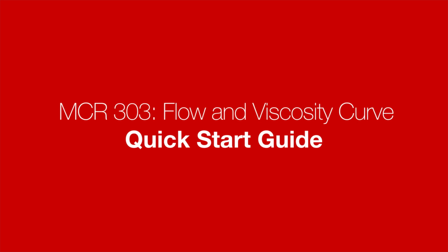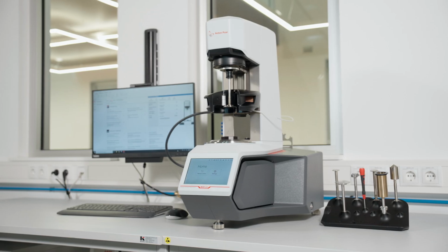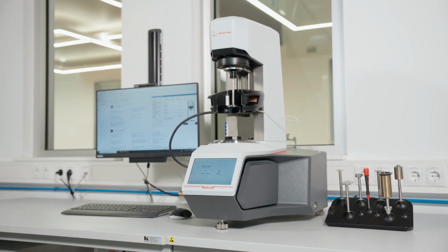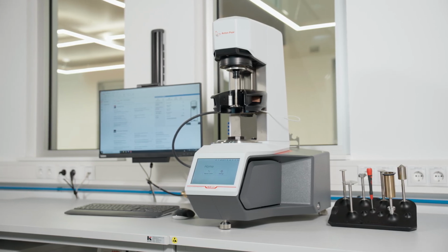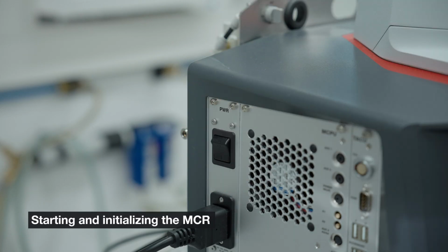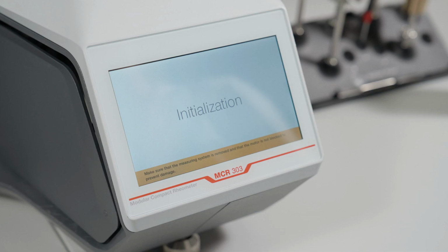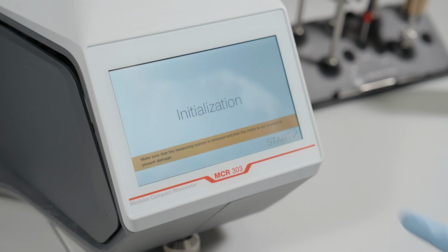In this video, we will show you how to use the MCR XX3 Rheometer with Peltier temperature devices to measure a flow curve and a viscosity curve. Turn on the MCR. Click Start either in the control panel or on the touchscreen of the MCR.